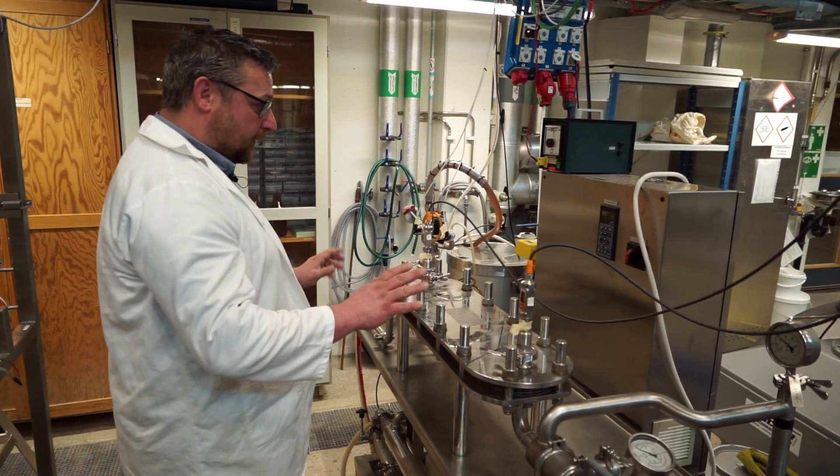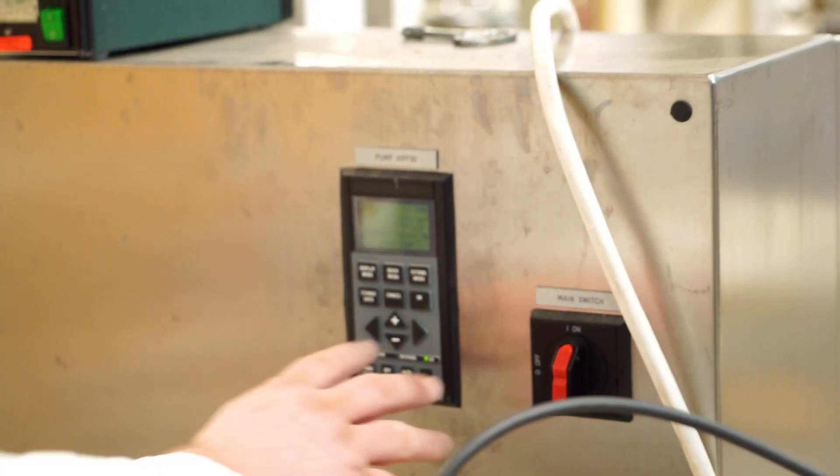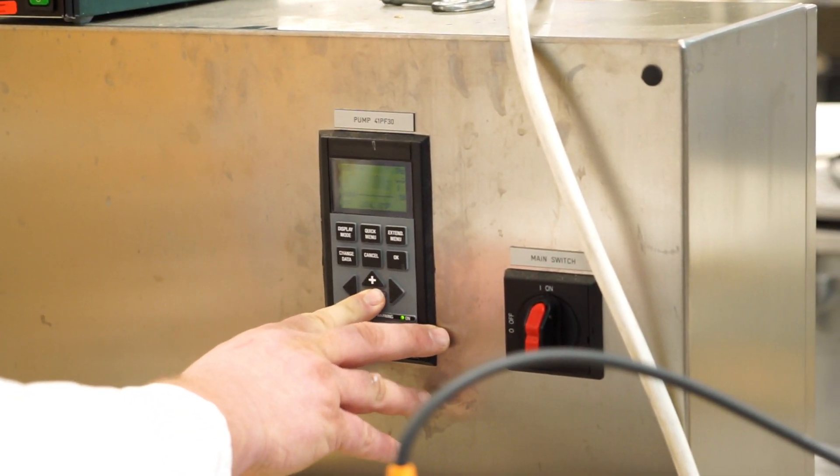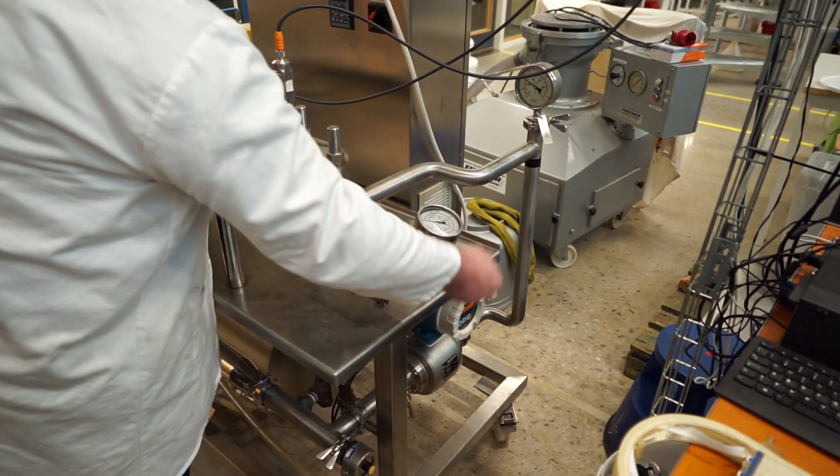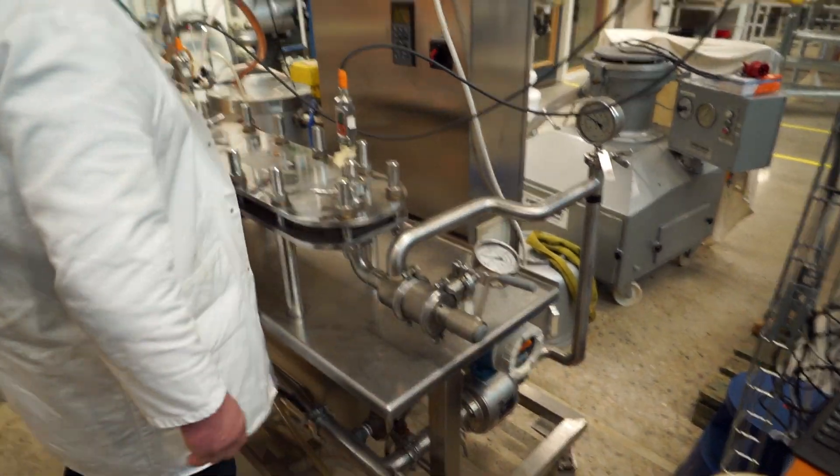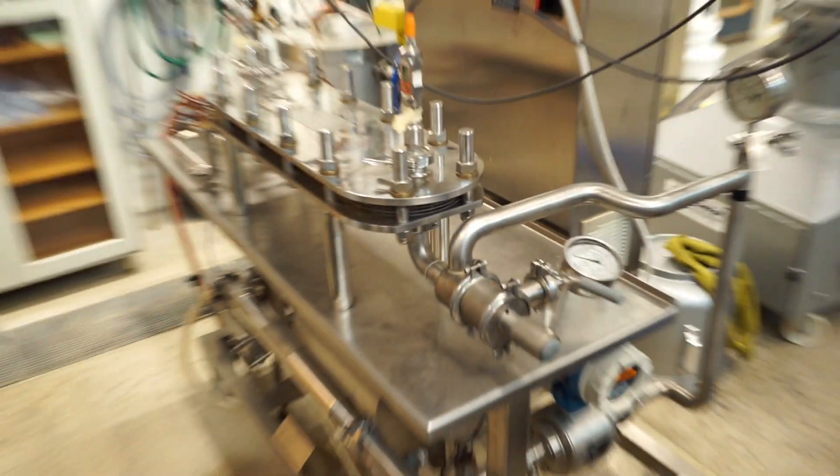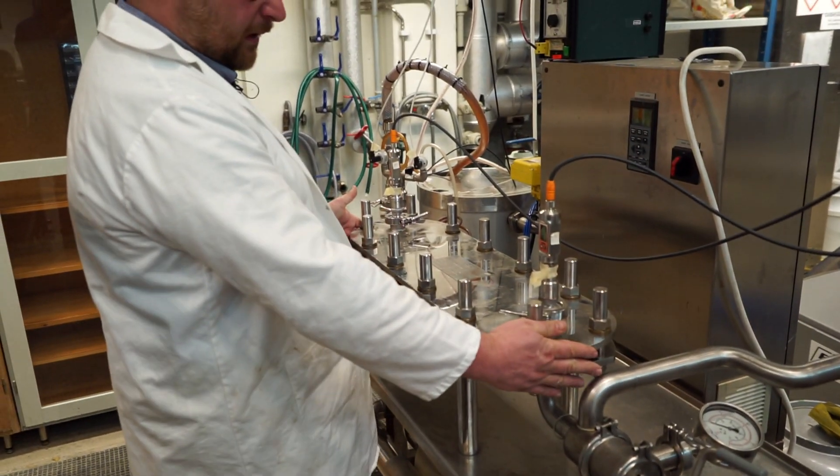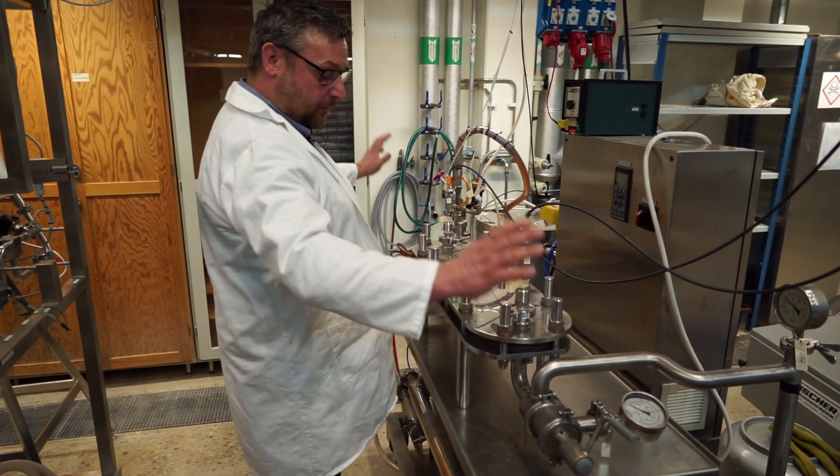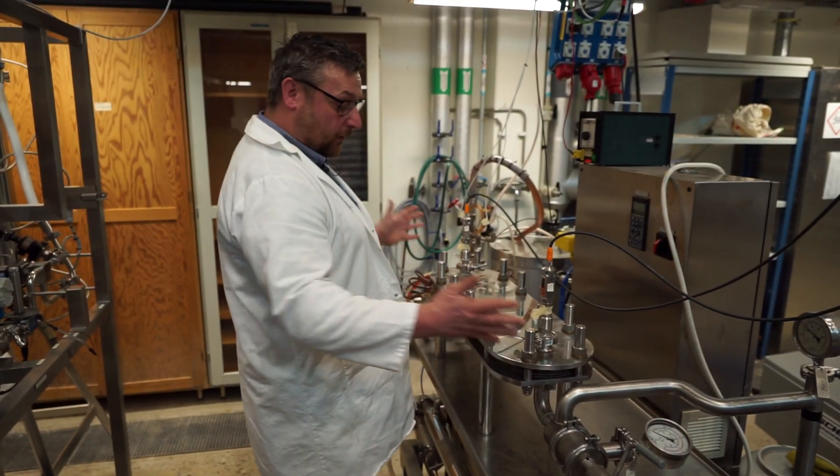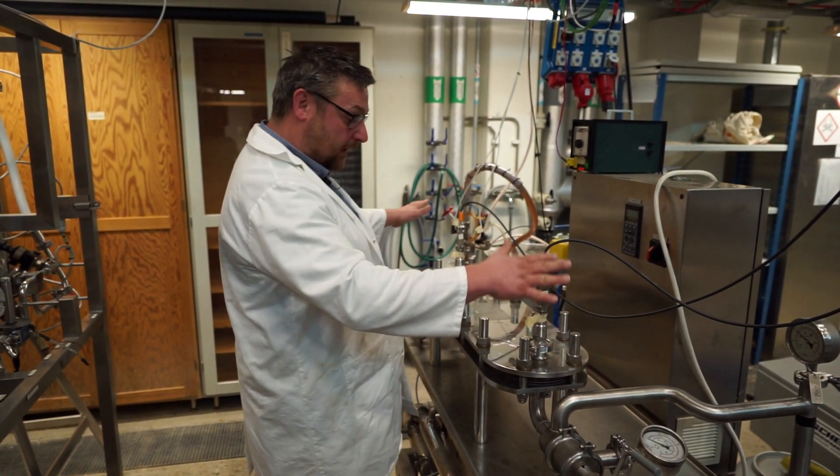So, let's see if we can start this one up. This is a little bit of control for this equipment. I'll reduce the speed of the pump, I'll open the valve, and I will open this valve on this side. So, the valves you open now, what are they? They are two sections of the membrane module. If for some reason I want to stop everything, I can close that one up, and I know that I can remove everything here, change the membranes, and still have liquid in the system.